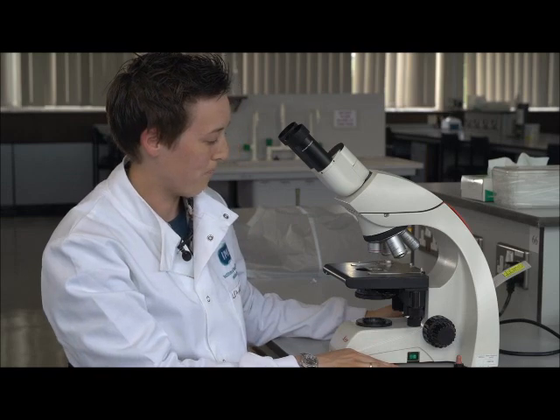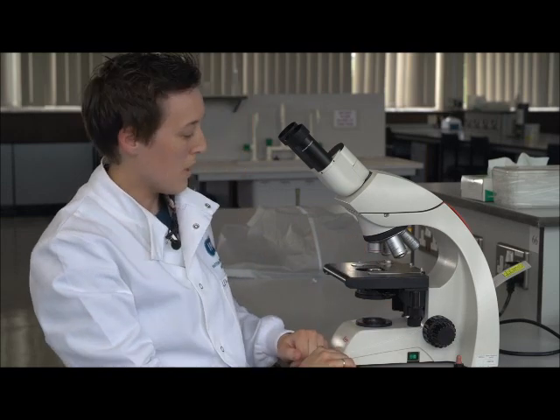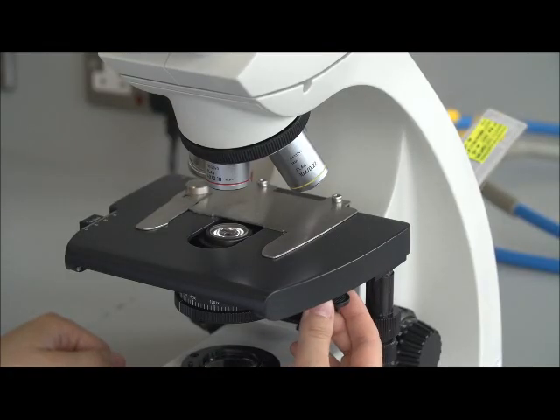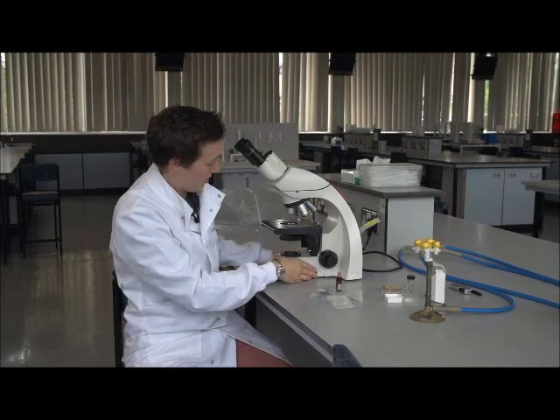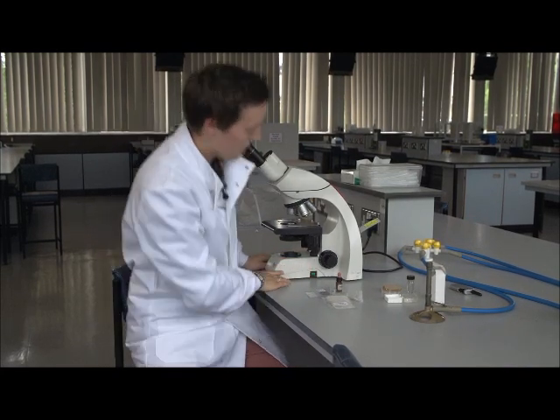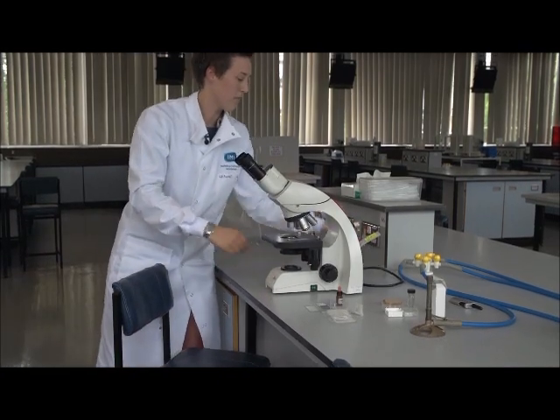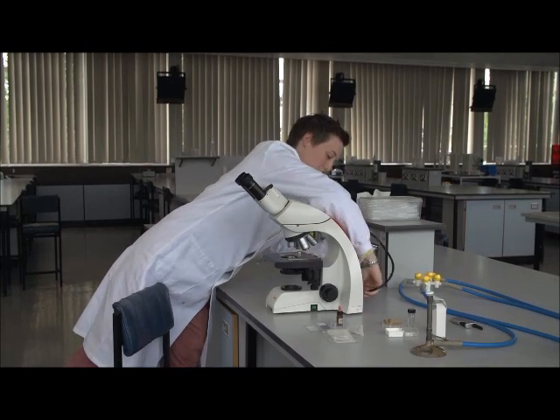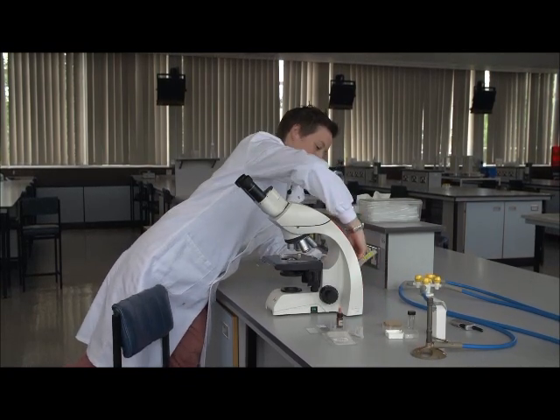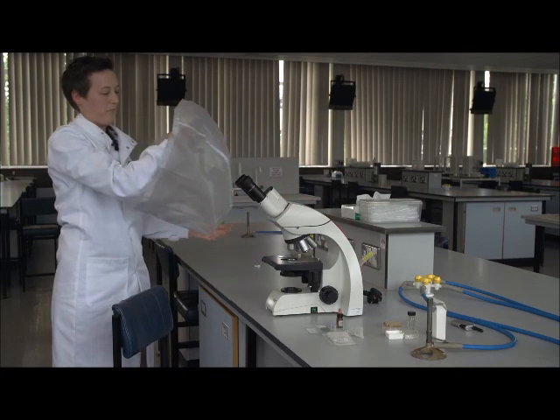So, now that we've finished using the microscope, we want to make sure that the phase ring is out for the next user. We want to make sure that the light levels are down, and then we can switch it off. We can then wrap up the cord on the back, which goes nicely into the holder here at the back. And remember to put the cover back on.